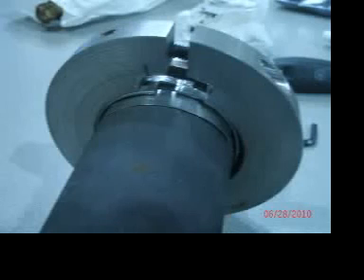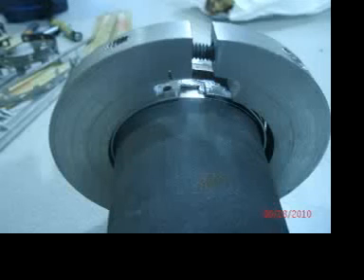Once you actually start putting it together, start clamping it, but before you get too far, you do have to put that piece of shim underneath the clamp area. If you don't put it in now, you won't get it in, and if you don't put it in at all, the ends of the clamp will definitely cut into the bladder and cause it to leak.